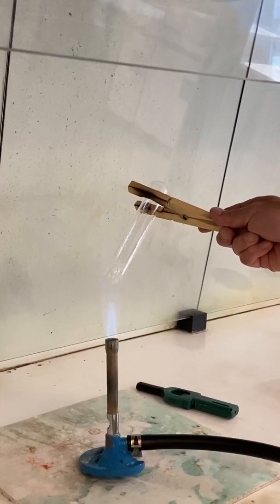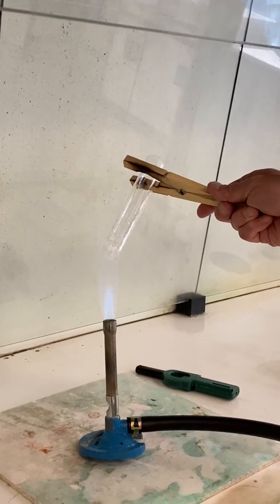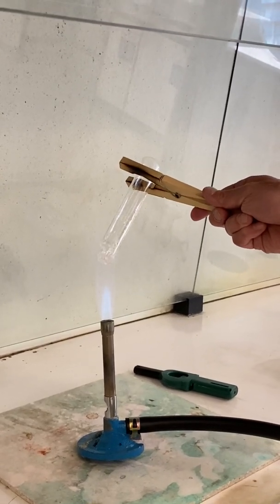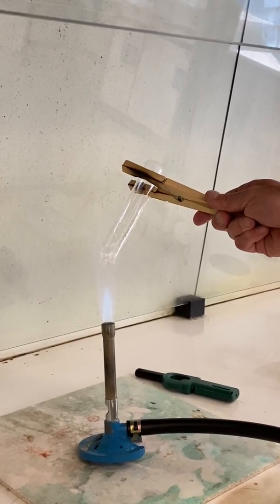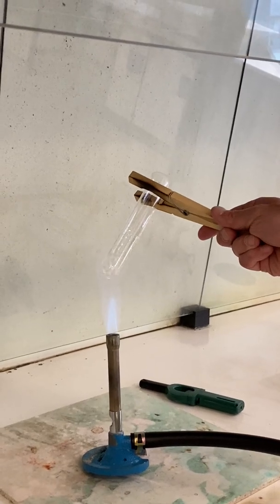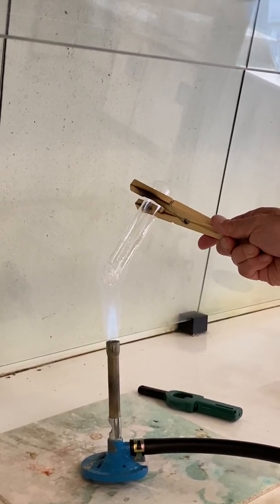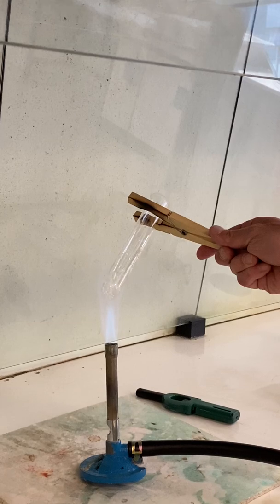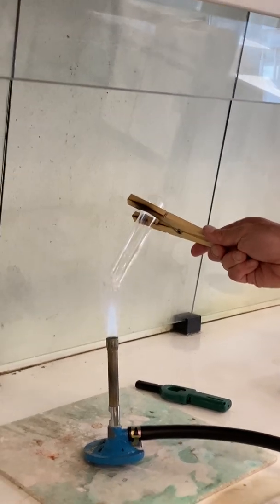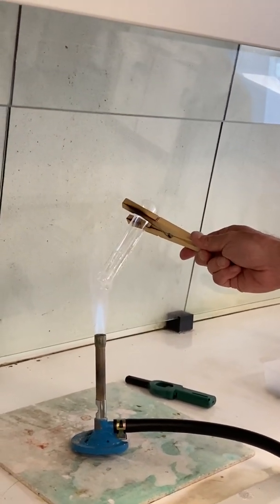What are we looking for here? We're looking for brown smoke. Eventually we should see some brown smoke. The magnesium ion has quite high charge density — it's going to polarize the nitrate ion, and once we've driven off all this water we should be able to start seeing some brown smoke.